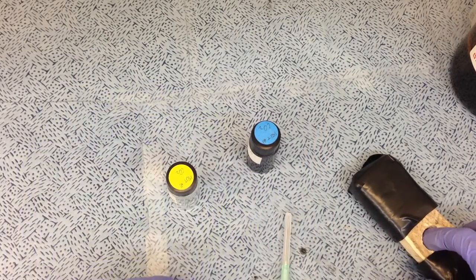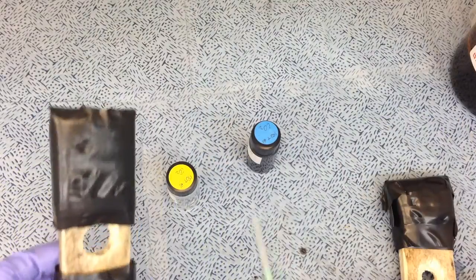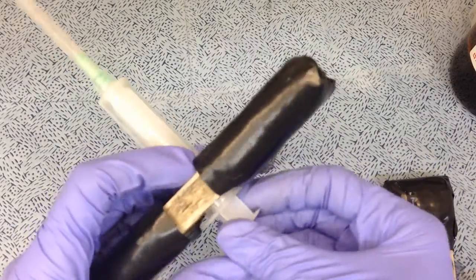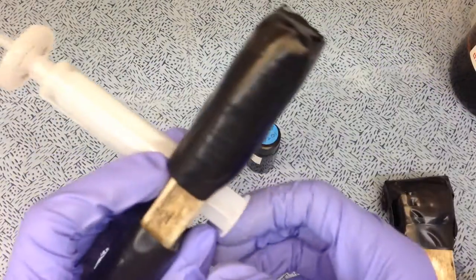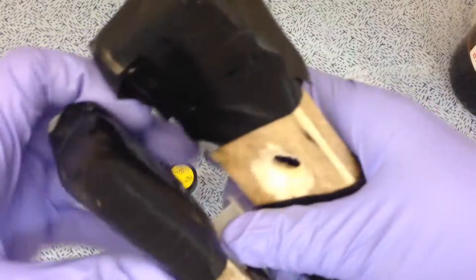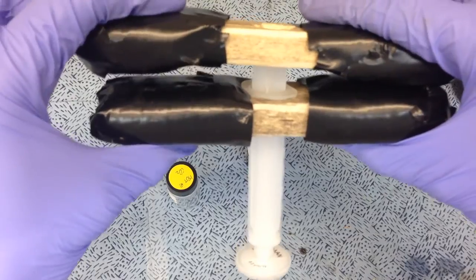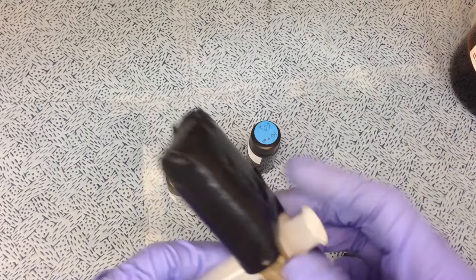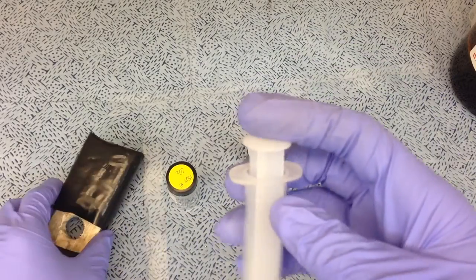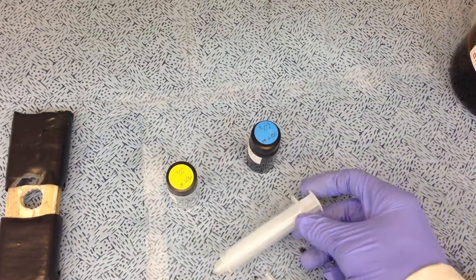And I was running into that a lot, so I spent just a couple seconds making these two blocks. The way they work is, I get them on my syringe, and once I take the filter off, I put it on, and now it's kind of locked on there, and then I pull in. I use these two as like a sandwich, or as handles, so I get a ton better leverage, and I can use the entire strength of my hands, rather than just my fingers. And it saves my hands a lot. And I'll show you it in action.